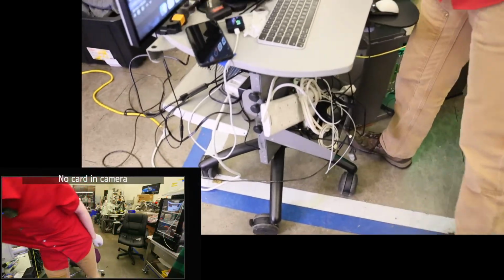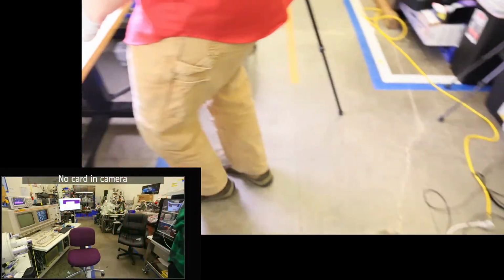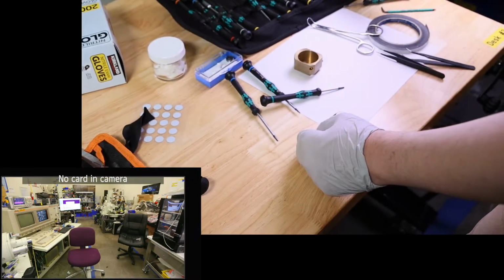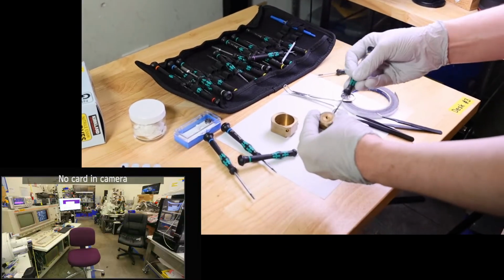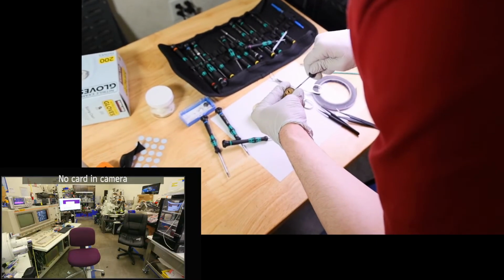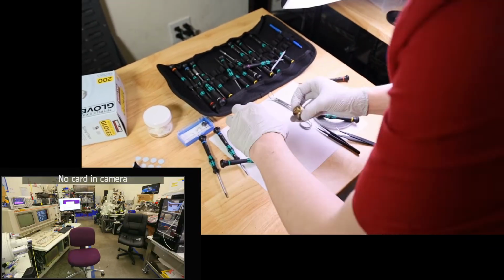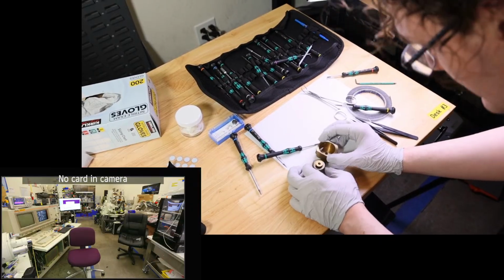Okay, the question is, which one do I want to use for this? We'll go ahead and use that one. I think we can make this one work. So what I'm going to do is we're going to run this one as tall as we can. So the height we want this to be at is the height that the top of this is at. So we're going to be a little bit low, but that'll be just fine.